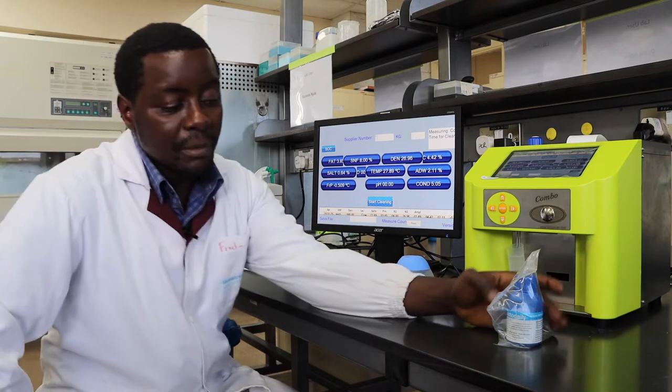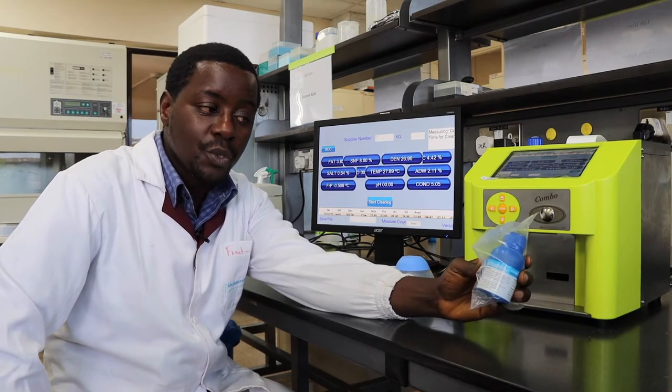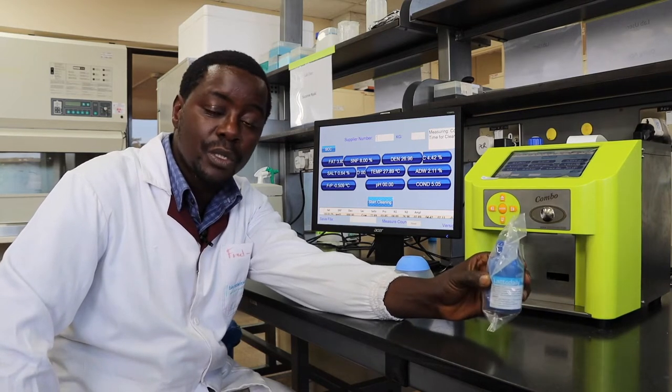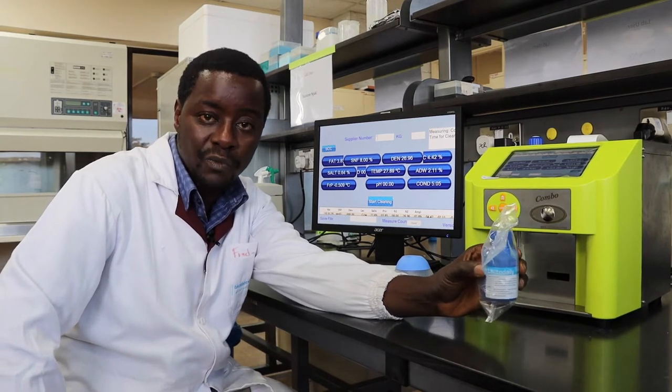The instrument is supplied with a clean solution, the LactoDaily cleaning solution. You need to reconstitute it so that you achieve a concentration of about three percent. That is three grams of this solution in 100 ml of water.